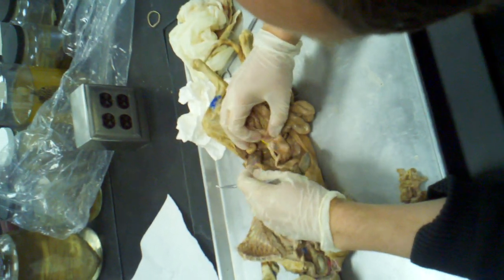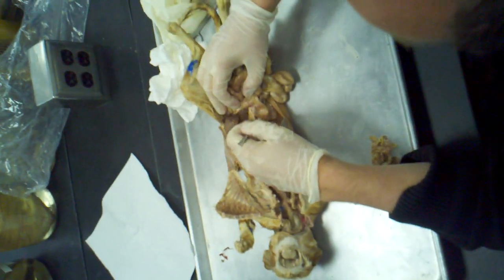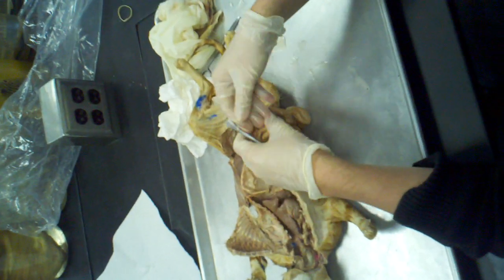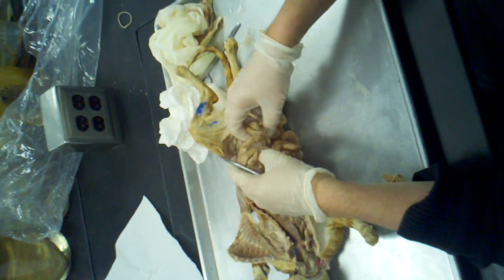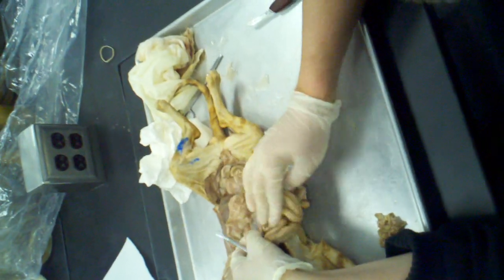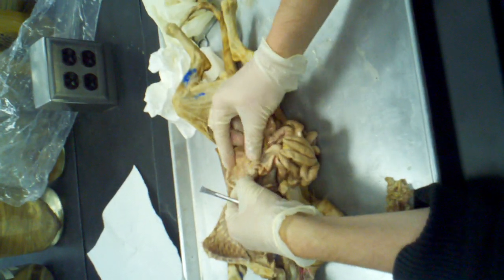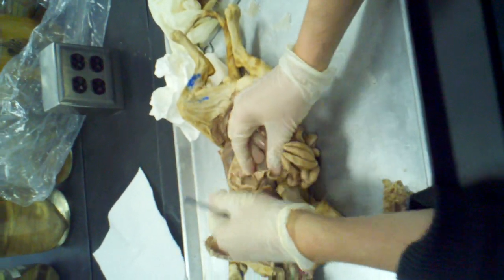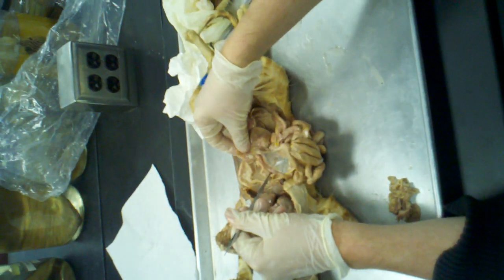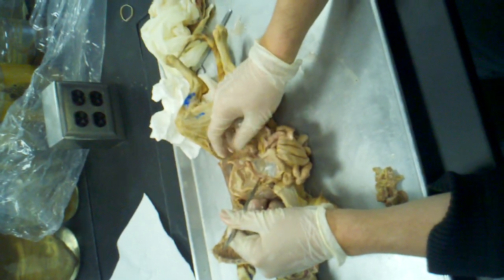If I would pin the jejunum, which is the first part of the smaller intestine, I would pin it right after the duodenum, so somewhere over here. Somewhere in the middle here, the jejunum turns into the ileum, and the ileum is the last part. And now I'm just going to keep going until I find this part where you can see the lesser intestine starting to widen into the greater intestine. So if I would put a pin right there, you know you're on the lesser intestine, but you're right next to the greater intestine, so you are on the end part of that, which is known as the ileum.